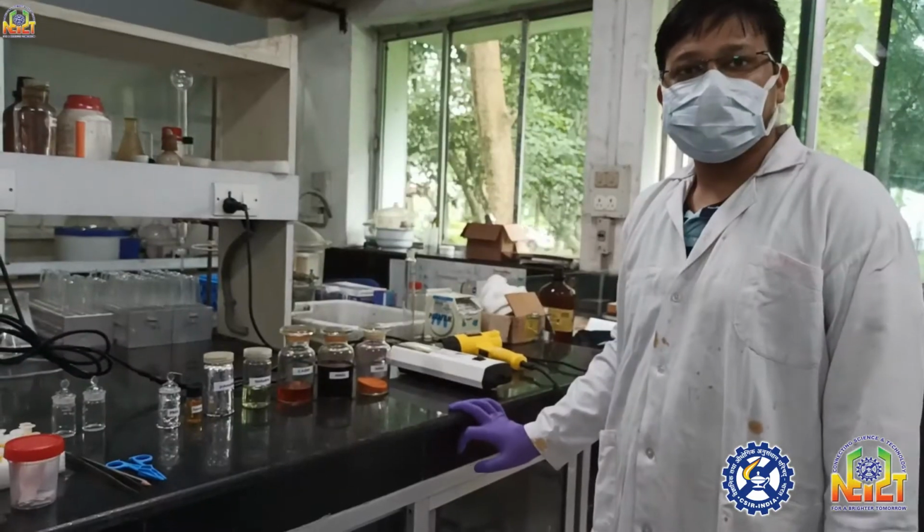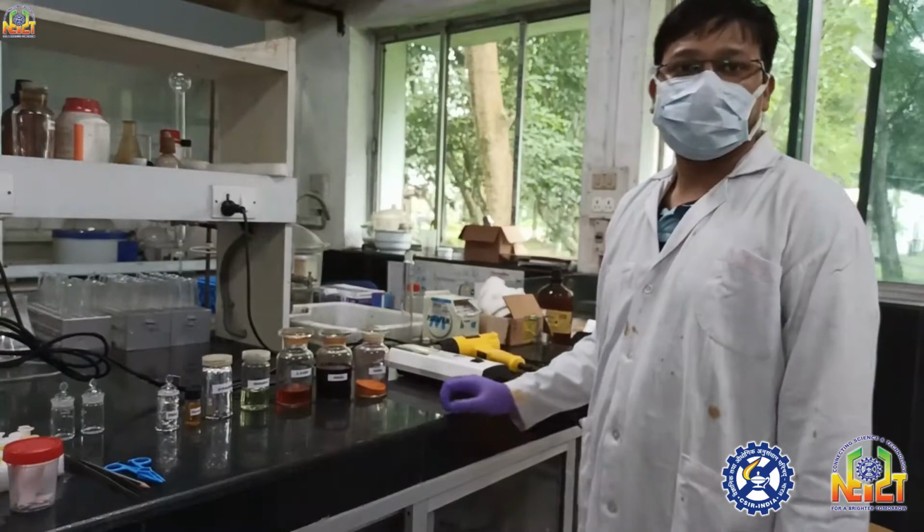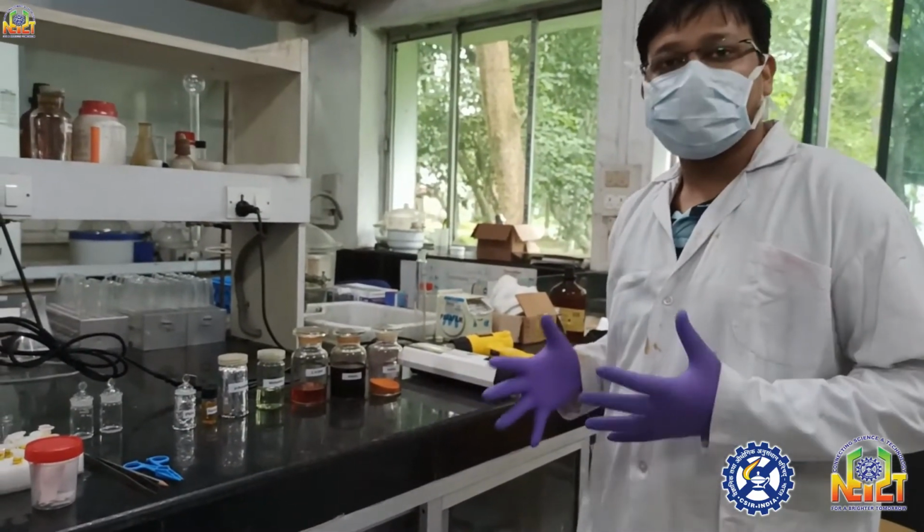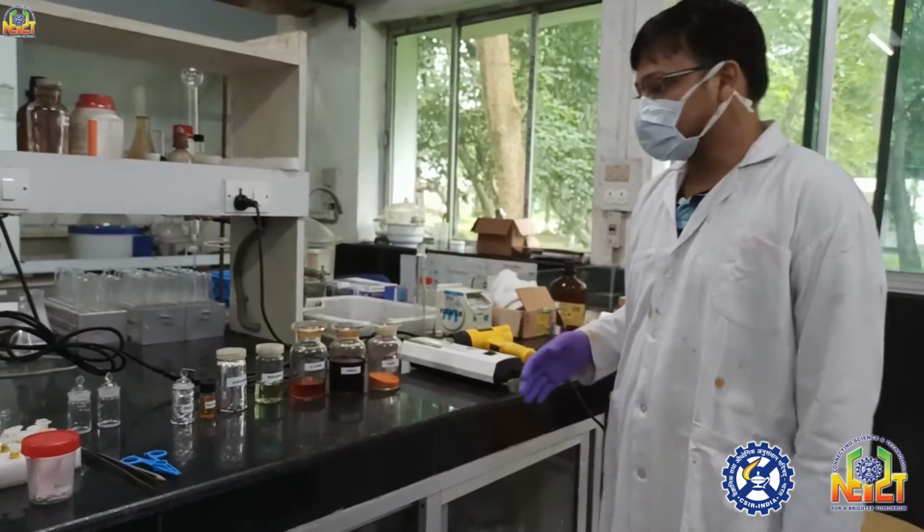Hello friends, myself Gaurav Kumar Rastogi working in Applied Organic Chemistry Division. So today I am going to show you how we are looking at organic compounds on TLC plates.